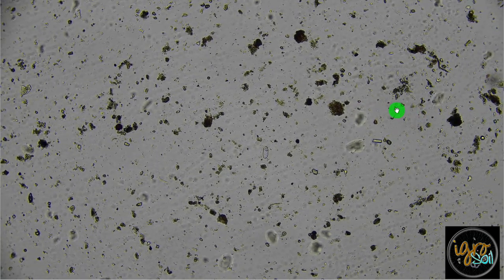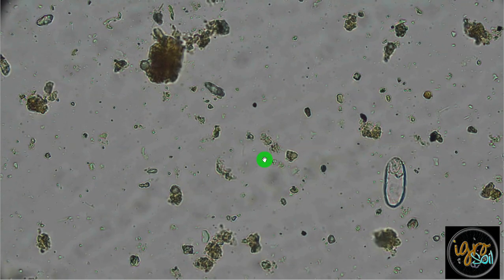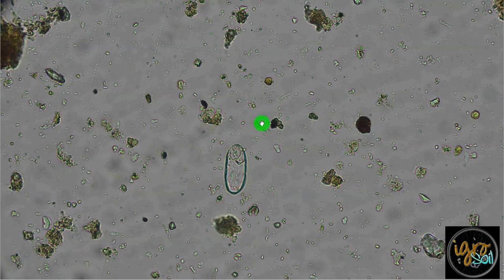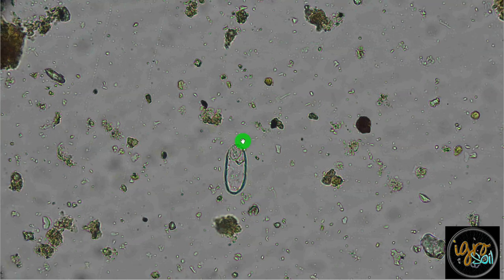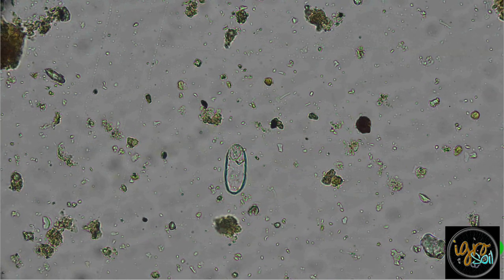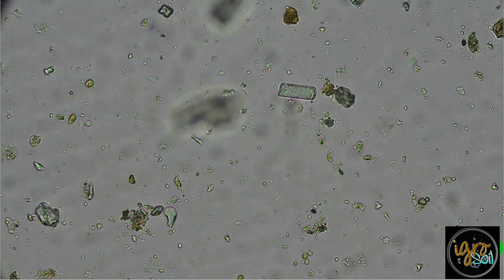Of all your slides, this is the first trace of a ciliate, or I'm sorry, even a protozoa or a predator for that matter. And that's what that was right there. All the stuff jittering in the background, all these little things moving around, it's all bacteria, very common, necessary and important, all part of the cycle.